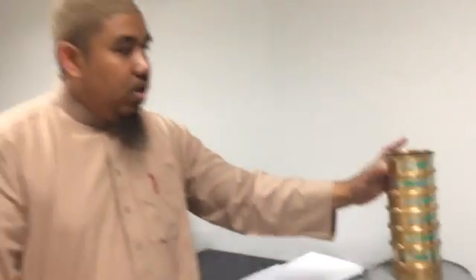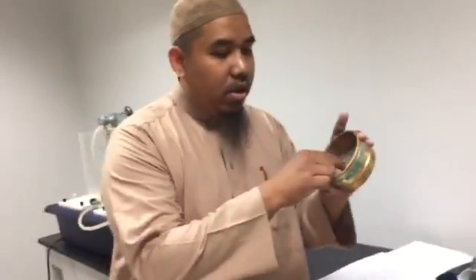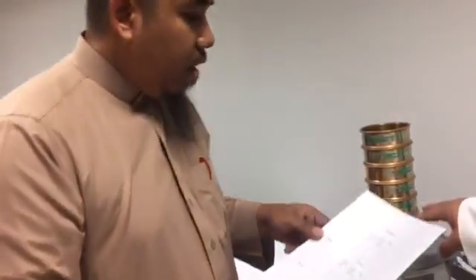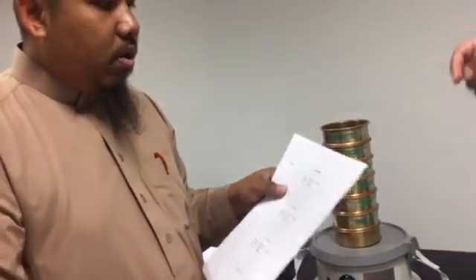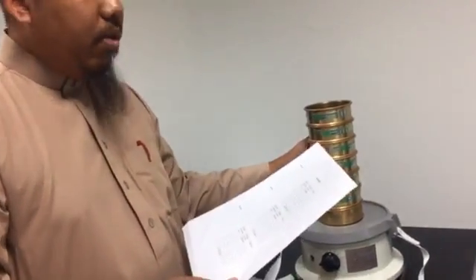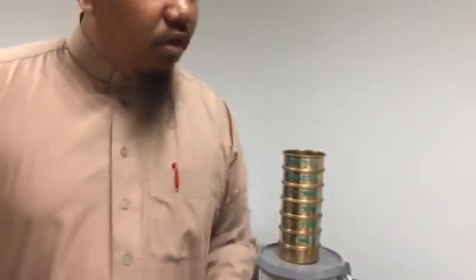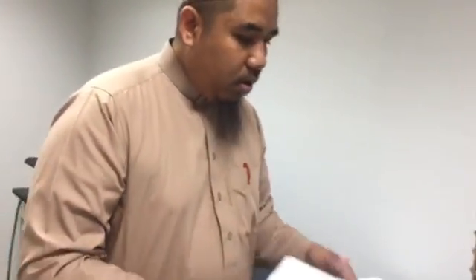After that, you measure how many grams you get for each size. Yes, for each size. So we have to measure each one without the sand, then measure it with the sand. You can do it like that, no problem. Or you put another beaker or something. Yes, beaker. So you just put it in the beaker.